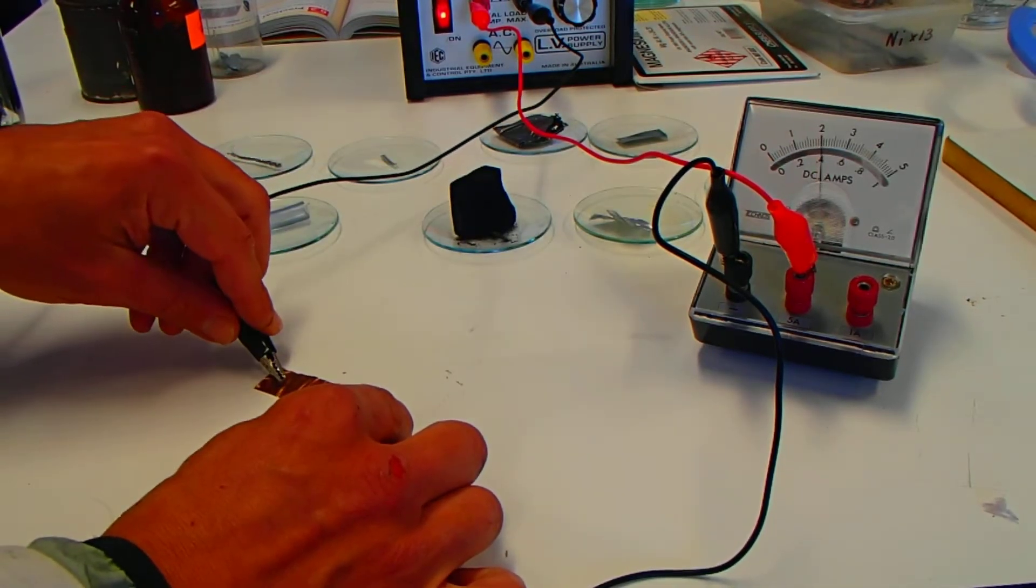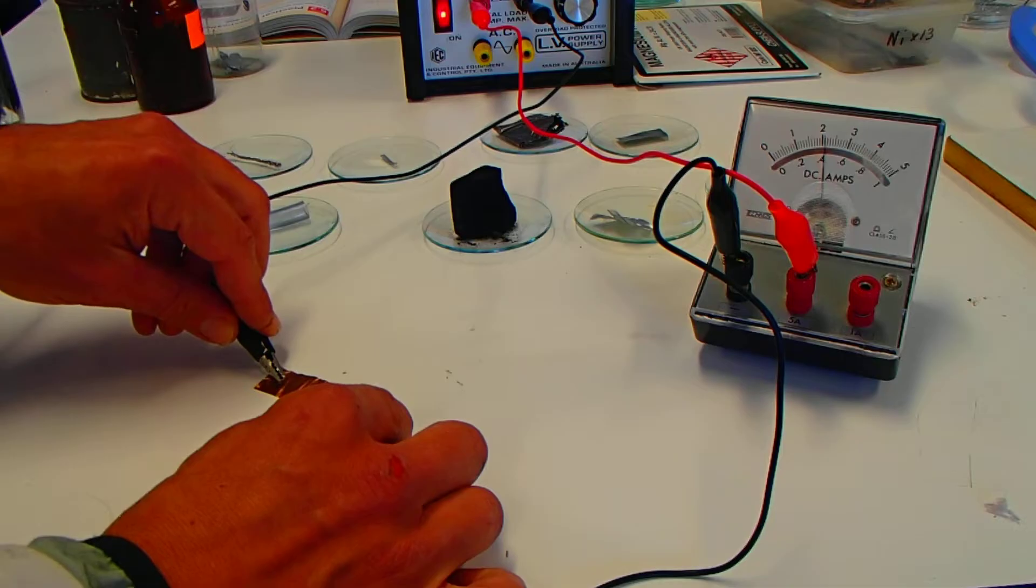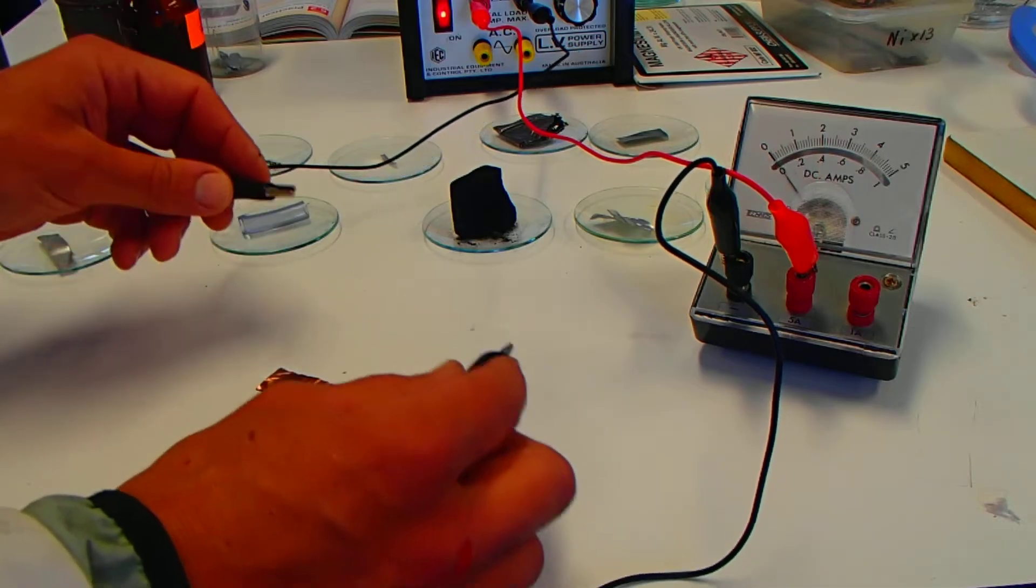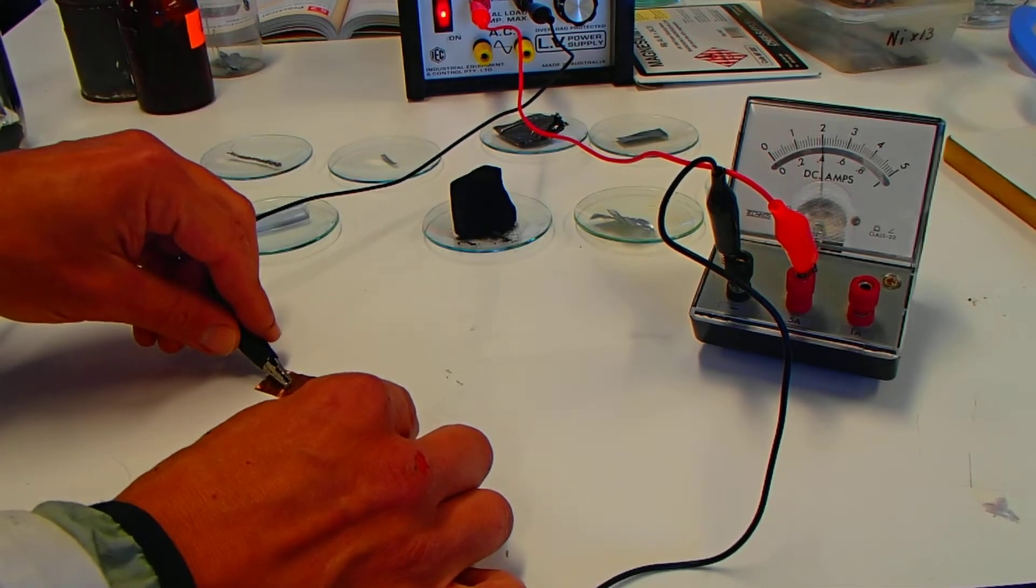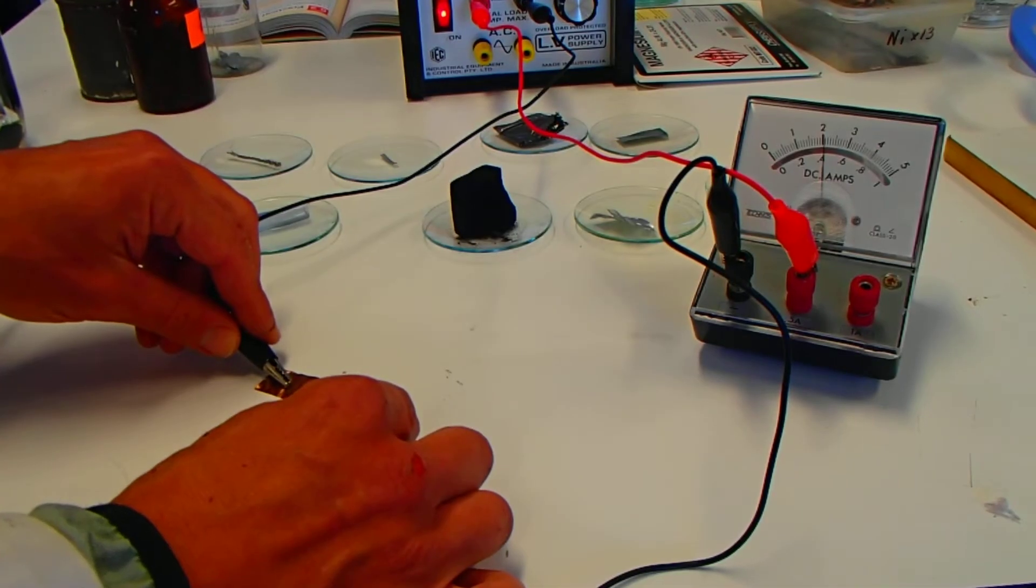So I've got one, I've got another. Yes, you can see it going up there. I'm just touching that on, and it's going up, showing some current is passing through that sample of copper.